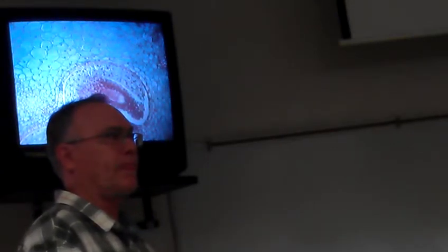Bunch of them that are okay, not great. All right, so let's look at this one, and this is probably an embryo sac. An embryo sac is haploid and represents the what? Megagametophyte. This is the megagametophyte generation, mature. It's the whole thing.